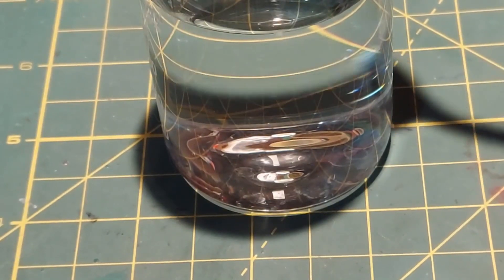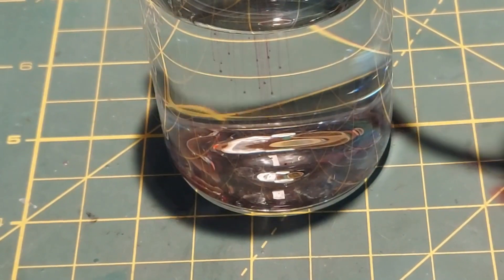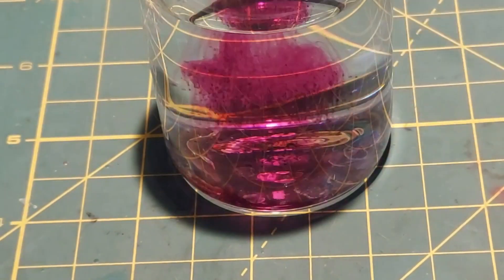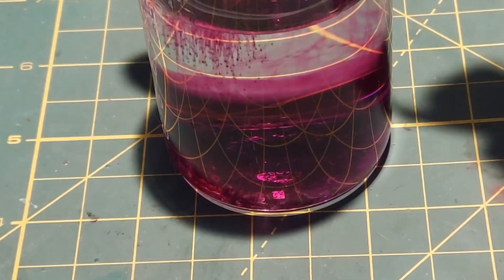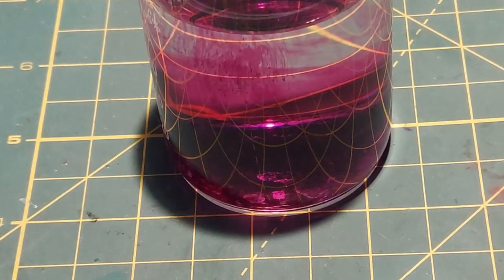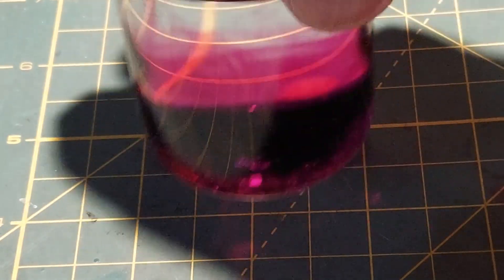I'm blocking the light there, but I'll move this. It turns it a very pretty purple color. This stuff is pretty expensive also, so I'm not going to do more than that. But it's just a nice, very pleasing purple color.